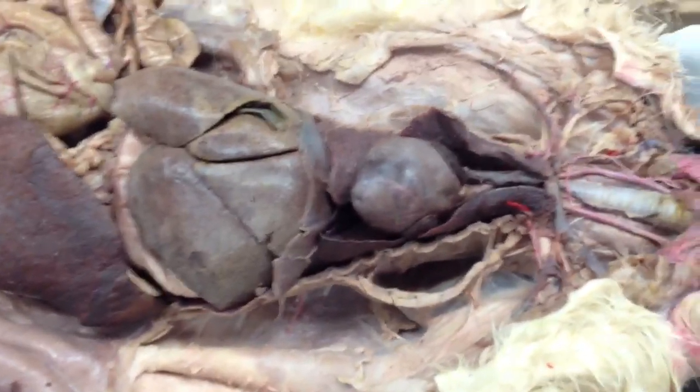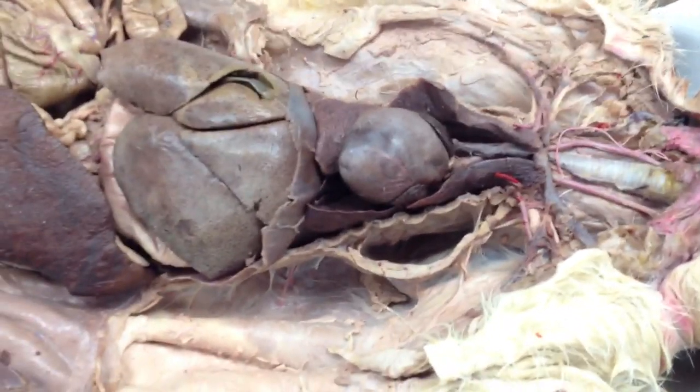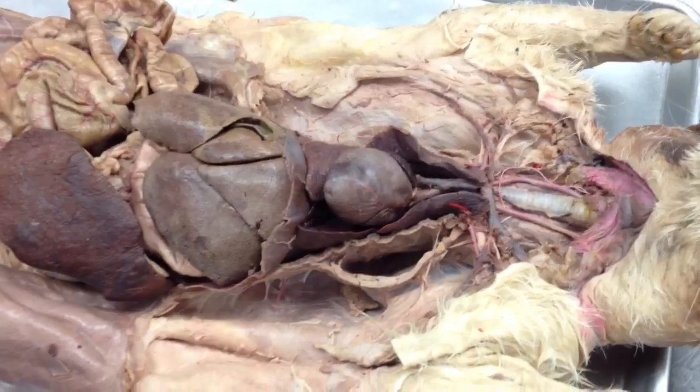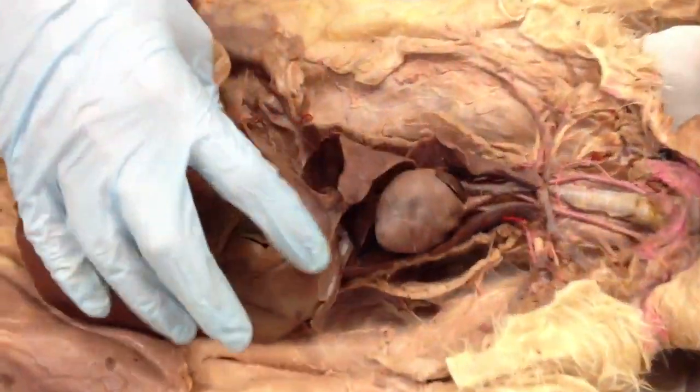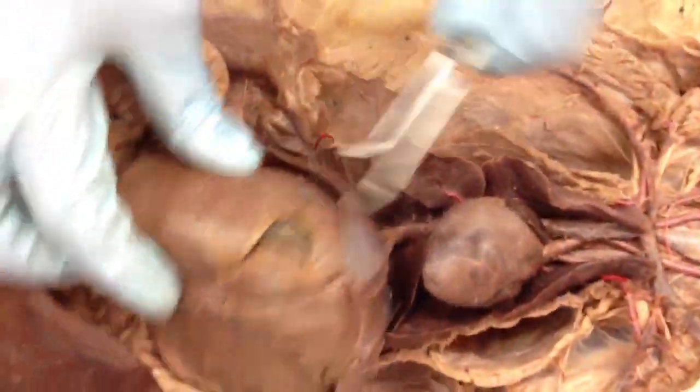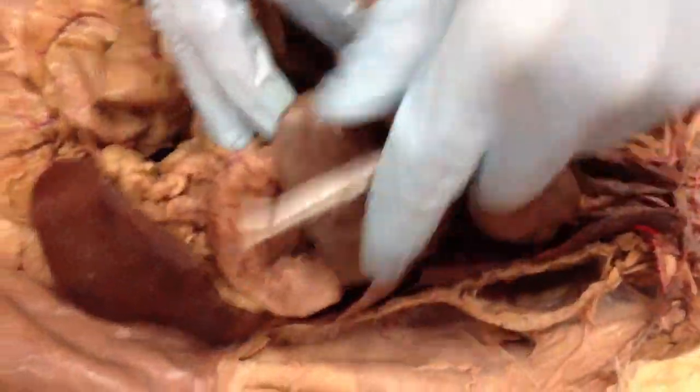I'm going to skip over hepatic vein and hepatic portal vein. I'll come back to them in a second. Renal vein, kidneys, renal vein, renal artery. Your inferior, they mentioned the inferior vena cava multiple times. That's because it's right there. It runs through your liver here, this giant multi-lobe thing.